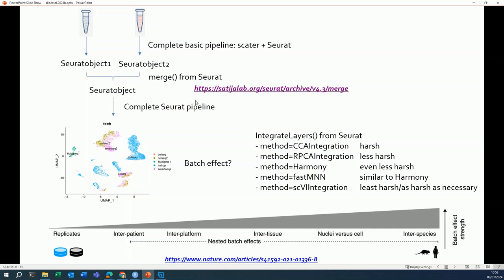When you have a Seurat object with combined samples, you go through the entire Seurat pipeline again, starting from the normalization up to the clustering and the UMAP. So you will produce a UMAP, and on the UMAP you will color the cells according to the sample they come from. And this will allow you to check whether you see any batch effects. How do you see batch effects? Well, either the different samples are shifted compared to each other, or, as is the case in this example, clusters consist solely of cells coming from one sample, and this is not a good thing.